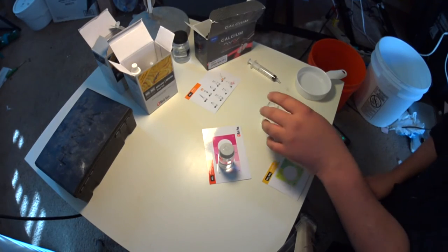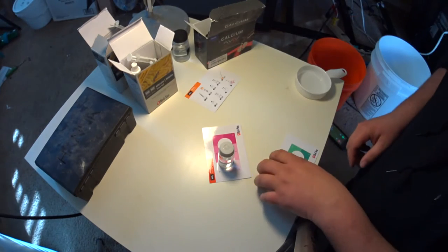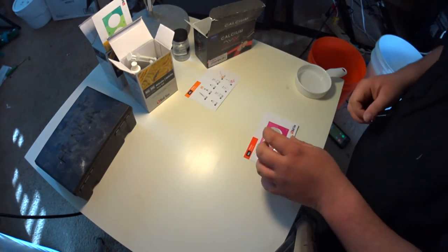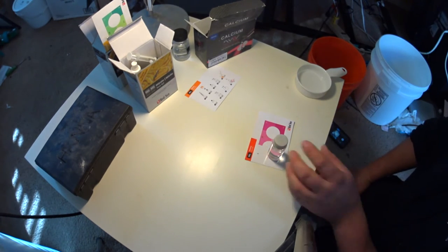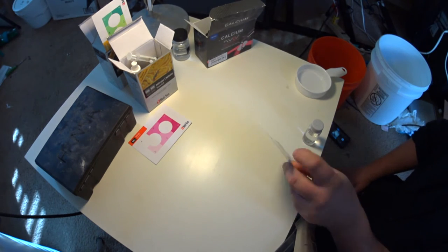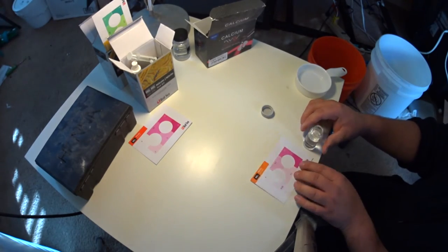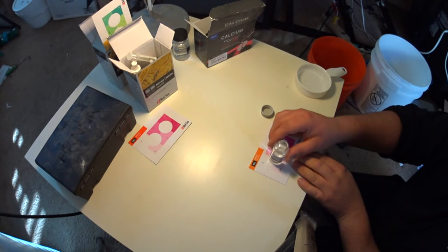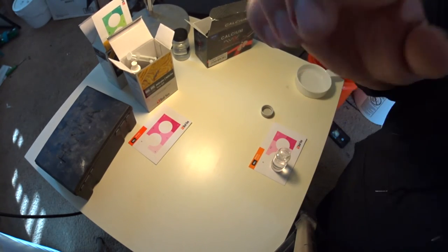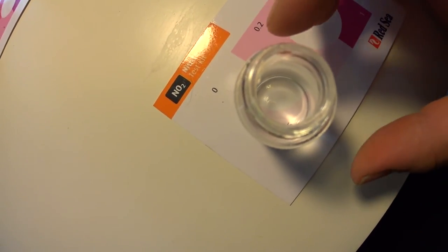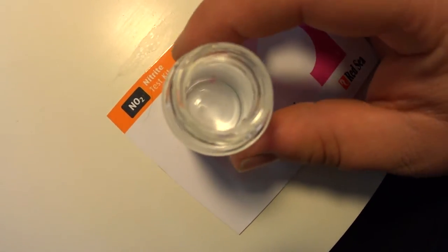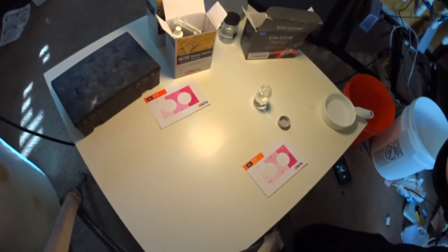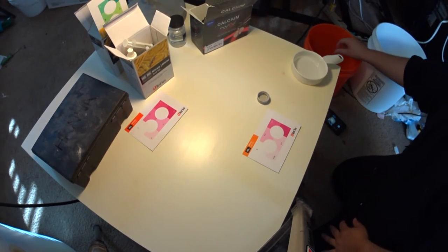So I'll dump this and rinse out these chemicals. All right, so then the next test we're going to do is, oh no, we're going to have to wait still a little bit. That was the ammonia, so let's go ahead and look at our nitrite. We've been waiting, so now we want to have zero nitrate or nitrite. So again, same thing - there's little white circles in the center and you just kind of compare it. You put half of your vial over the color and half of it over the white circle, and then you look from the top. It's definitely not pink. I don't know if you guys can see the pink through there, but definitely none of that. Then we just go over where it says zero nitrite and that looks good to me. So I'm going to say we've got zero nitrite.